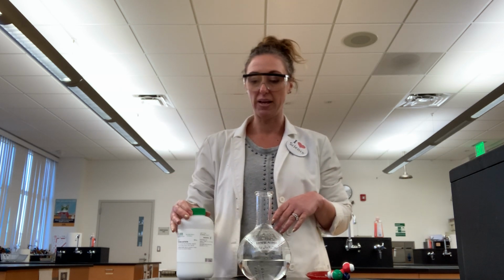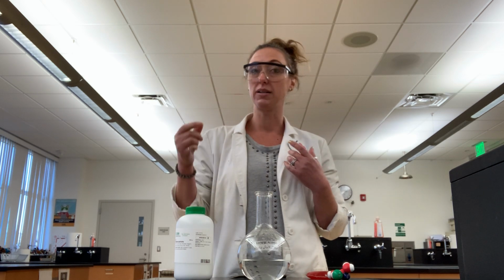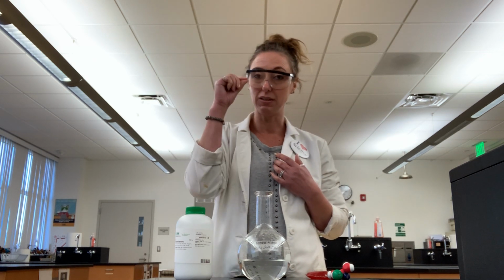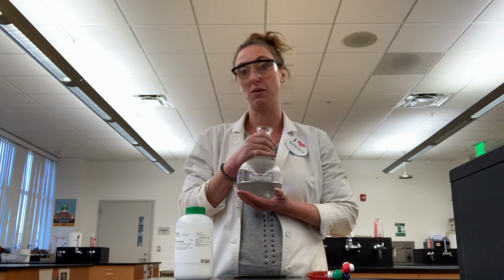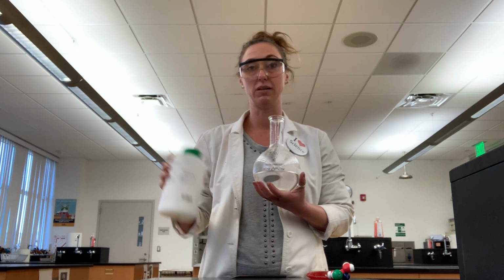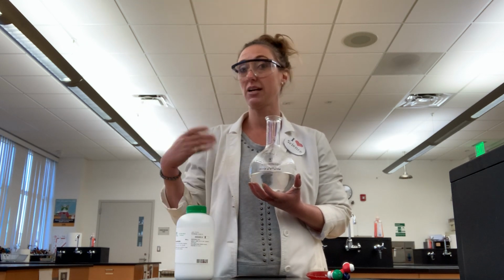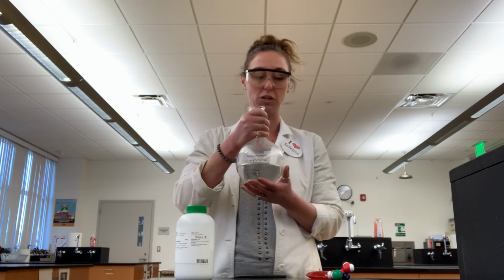And so what I have in this situation is actually switched. Water is the solute. There's just a little bit of water, and the vast majority of this is sodium acetate. So sodium acetate is supposed to be a solid at room temperature, but you can actually trick it into being a liquid at room temperature.